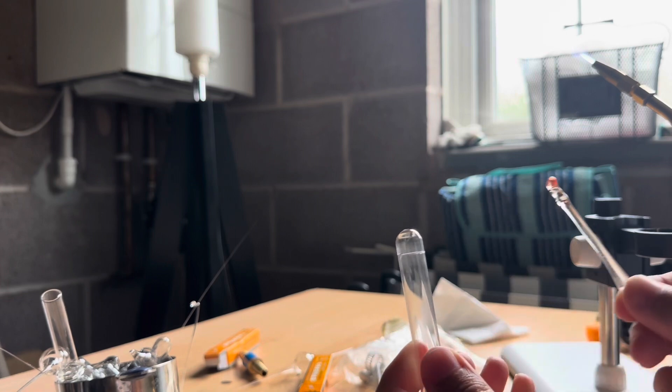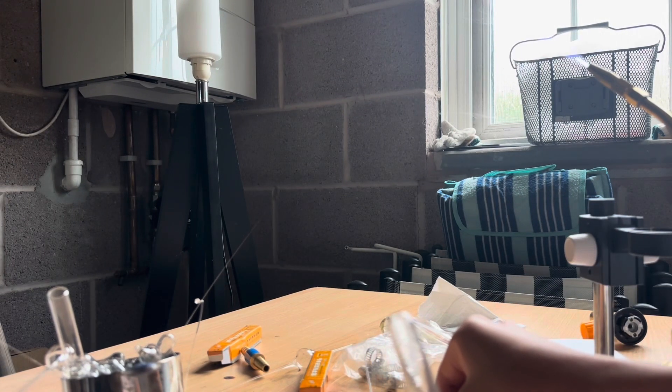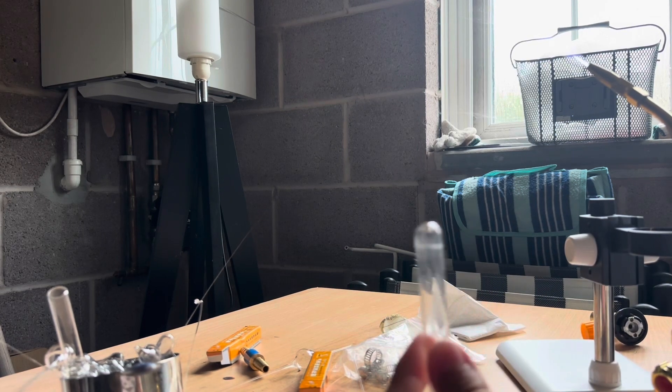Now, we crack the glass. When the glass is cracked, what we can do next, just let it cool a little bit.